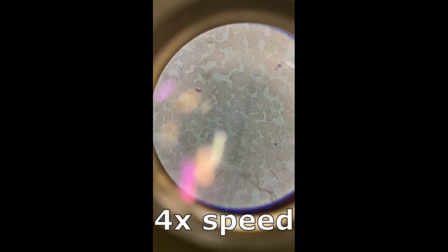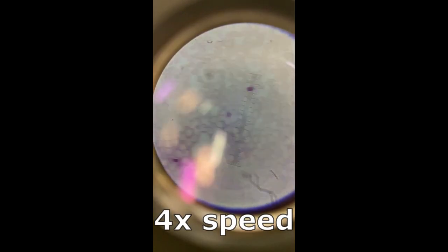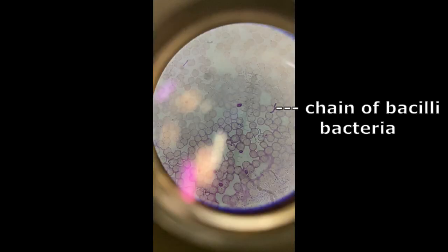In this microscope activity, we want to find a good view of the blood, yeast, and bacteria together in one place. But there are some other interesting things to see too. For example, here is a neutrophil. Here is a chain of bacilli bacteria.